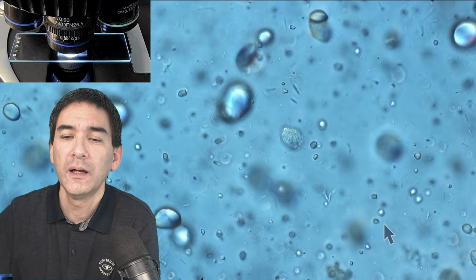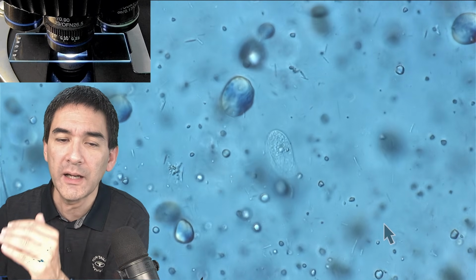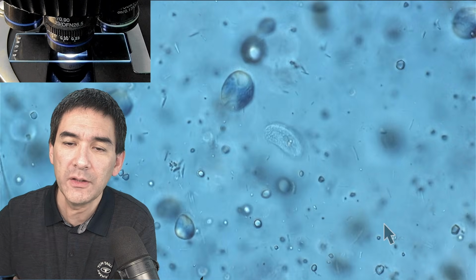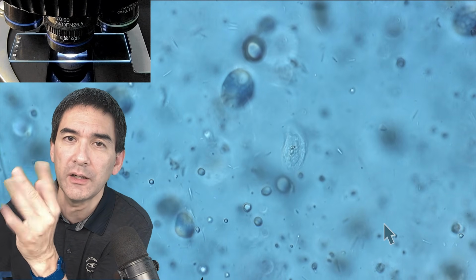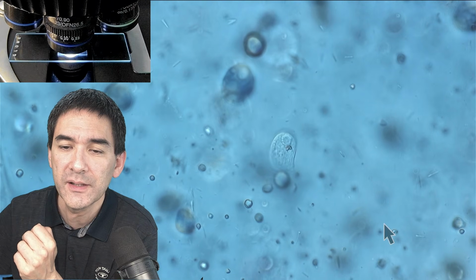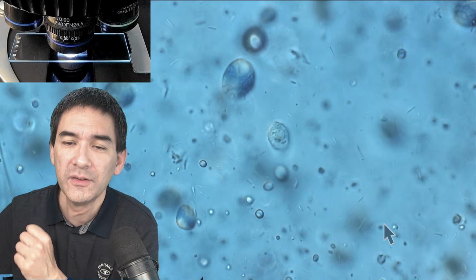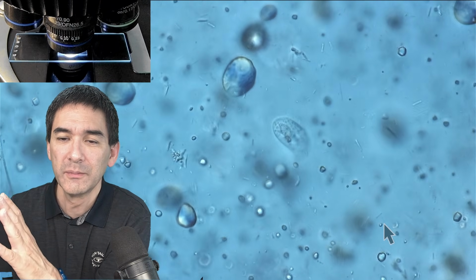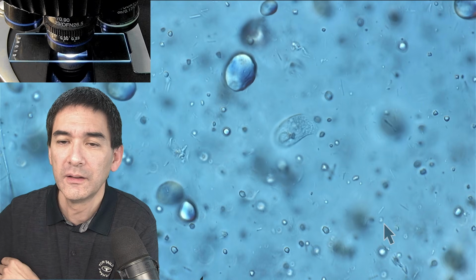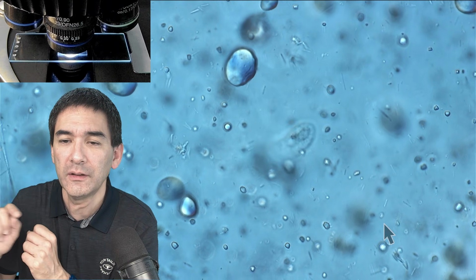Okay. Because the specimen is generally too thick, it's also going up and down, in and out of focus, right? And if you're a little bit lucky, you can actually also see now the cilia, which are the little hairs which are beating, right? That is also quite nice. Usually they are beating so quickly that you cannot see it. Yeah, and now you see it's kind of going upwards. I have to refocus again. Then, of course, you can also see those rod-shaped bacteria. Some of them are also moving around, if you look in the background.